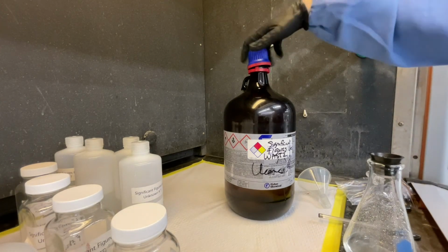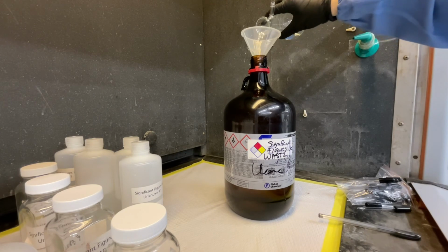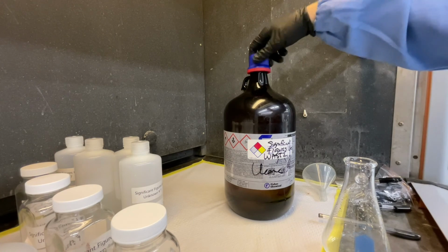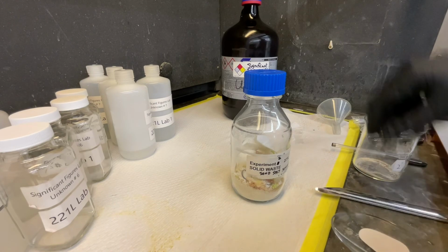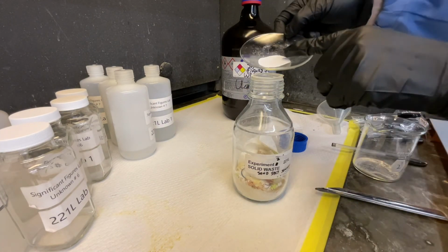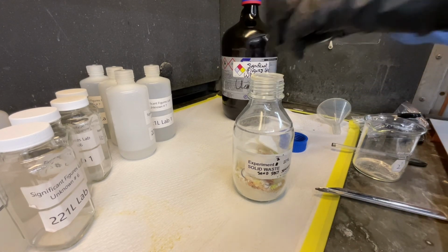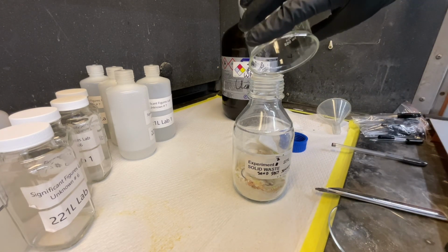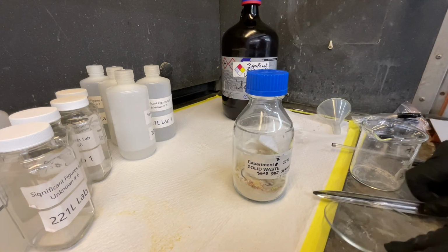Liquid waste should be carefully poured into a liquid waste container using a funnel. Be careful not to spill as you're transferring your waste into the waste container. Once you're done, remove the funnel and recap the waste. Solid waste, such as your filter paper containing product, should be transferred into a solid waste container. You can put the entire filter paper into this waste container. Any other solid waste should also be transferred into the solid waste container. Again, place the cap on the waste container before you leave the hood.